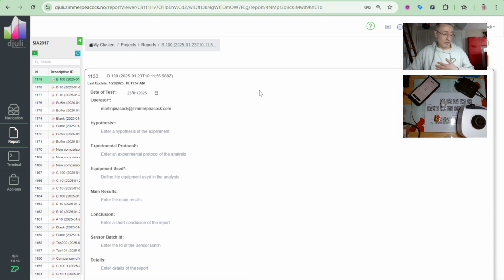So in summary, when I look at one of the tests, let's say, it's just flat. It reminds me very much of somebody who's tested just buffer. They did make electrical contact, I know that, but it reminds me of just a test with buffer. You can clearly see that, in fact, I have a sample that's kind of similar to what they're probably testing.